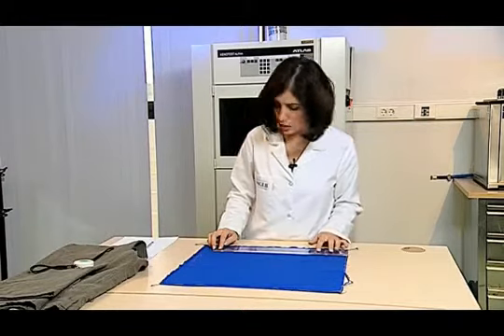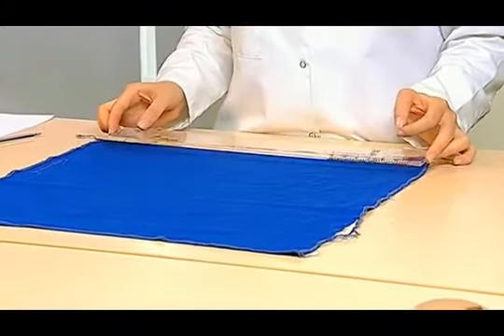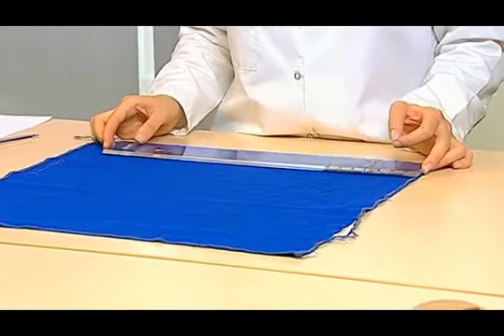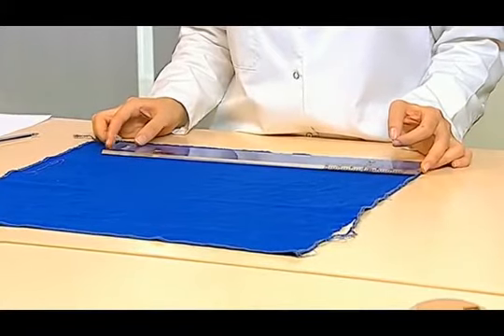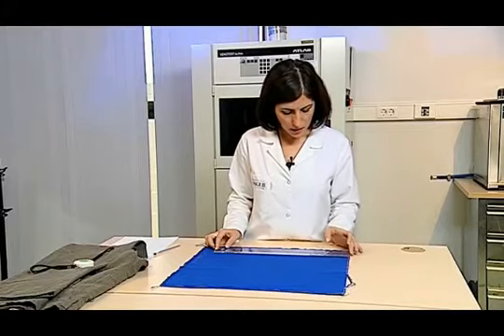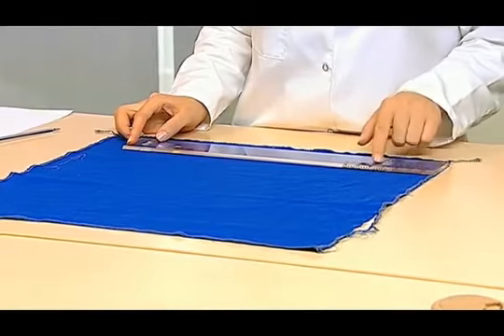To measure the amount of shrinkage and elongation of the test samples, the 0 point of the ruler is put at one of the marked points. Measuring the place of the 350 millimeter marked point on the shrinkage scale, we record it.